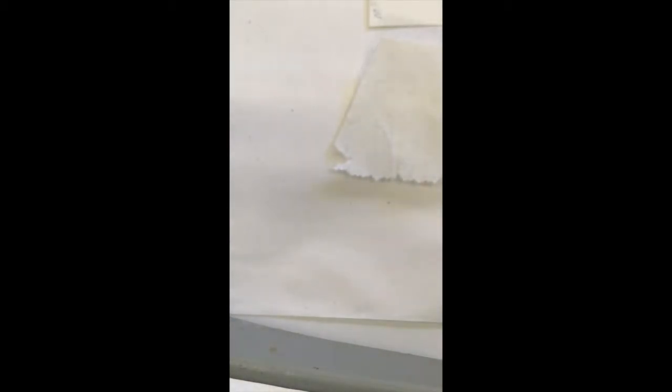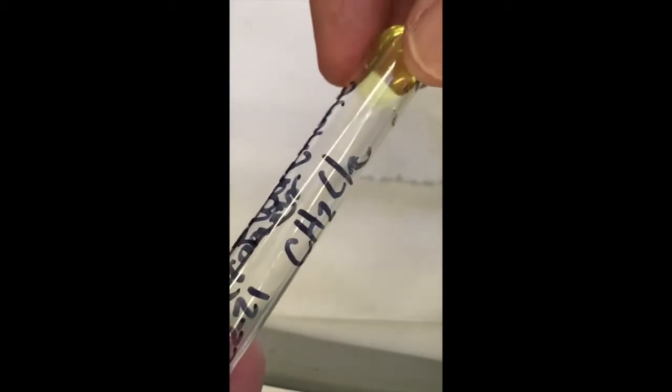So I added a pinch of fluorenone to a test tube, and then I added some methylene chloride. It's maybe like half a milliliter of methylene chloride in here. And I'm going to spot this as my fluorenone standard spot. So I'm going to get my capillary tube, stick that all the way down into the solution. And now I've drained out most of it onto a paper towel. Let me get my zoom in on this correctly.